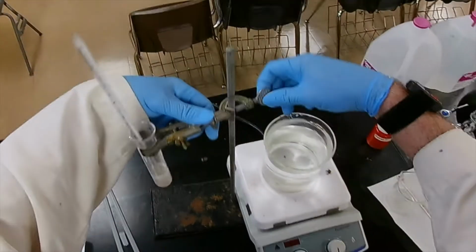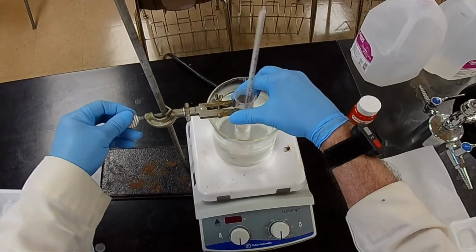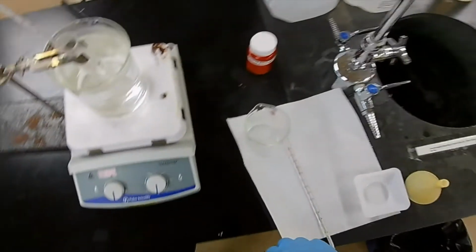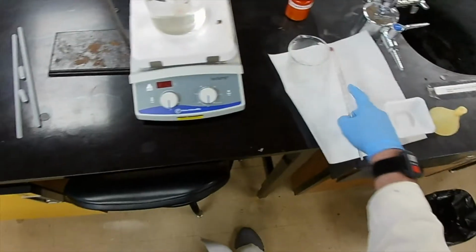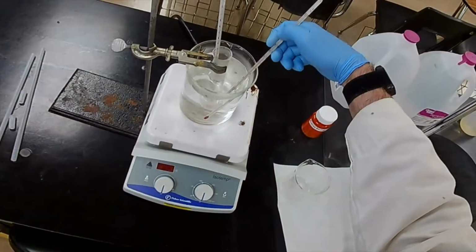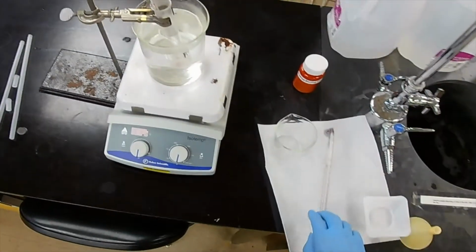Okay, now what are we going to do with our waste materials? Well, we can't very well get them out of the tube if they're solid. So we're going to lower it. The water's still hot enough. Just let it sit there. In fact, I'm pretty sure it's hot enough, because you can see it melting again. Oh yeah, it's well past the freezing point.